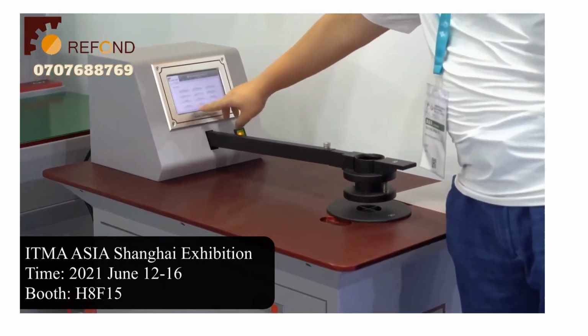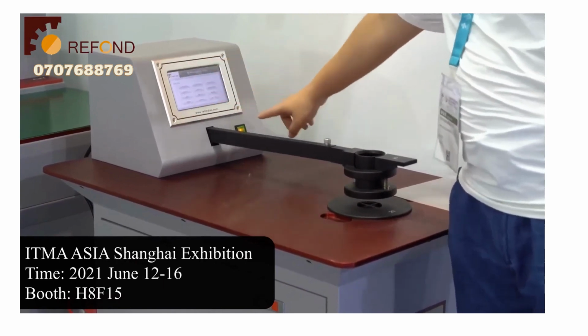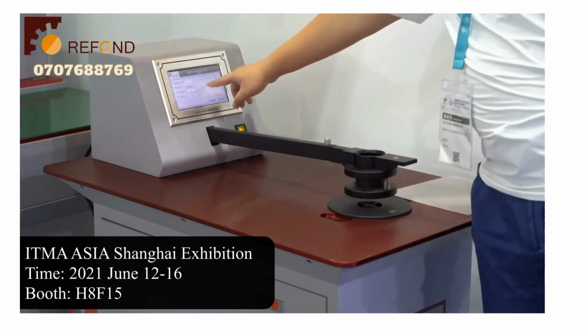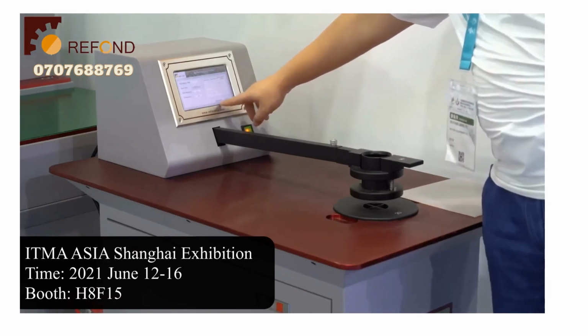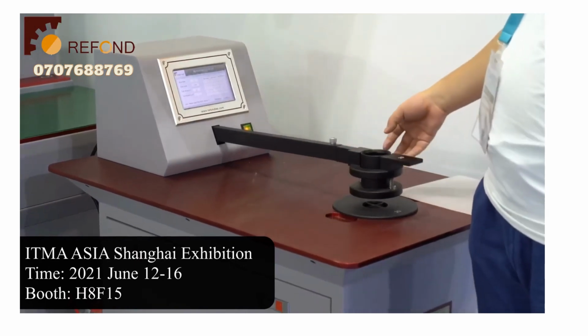The unit for the permeability index includes all of these options that you can choose from to meet the requirement of different standards. After the testing of one specimen, the test result and the test parameters will show in the table on the right.